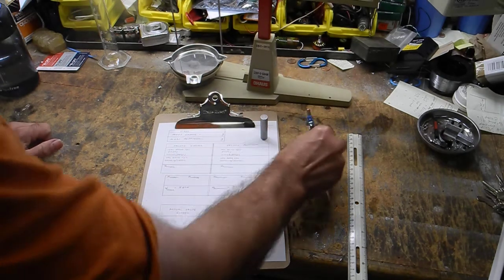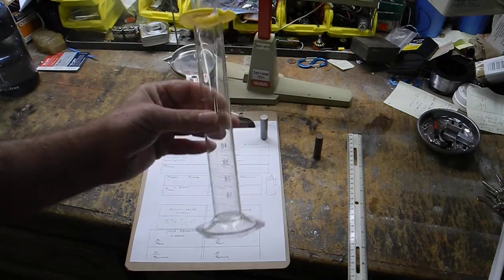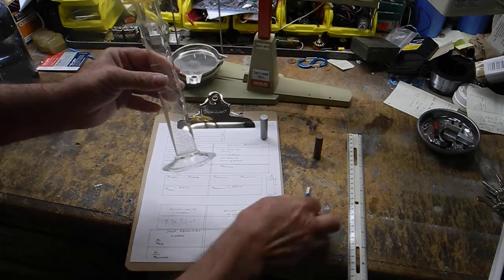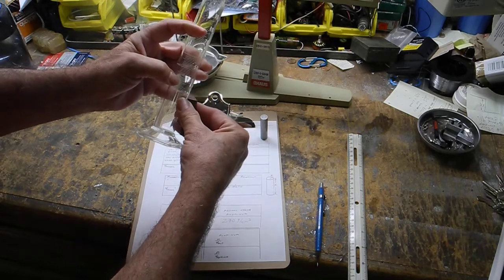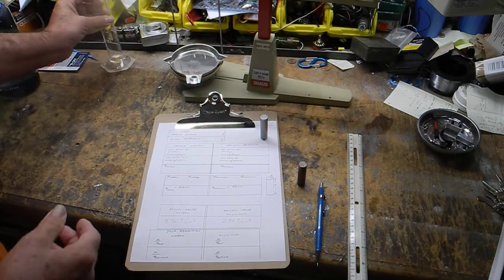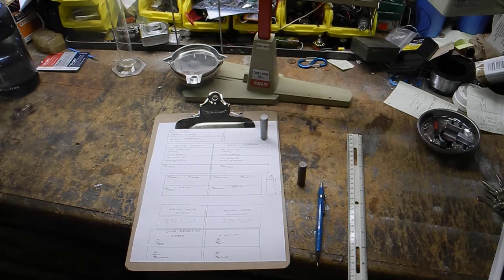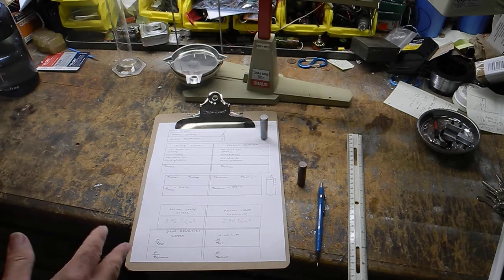The other method for finding volume is going to be by displacement of water. So we're going to fill some water in here. It doesn't matter how much you use, as long as it's enough to cover it. It has to be higher than this thing is tall, so somewhere up there. Put it in the water. The water level will go up. We subtract the difference, and whatever that is is the volume of this. The units of volume, when you do density, are typically cubic centimeters. But remember, a cubic centimeter and a milliliter are the same thing.